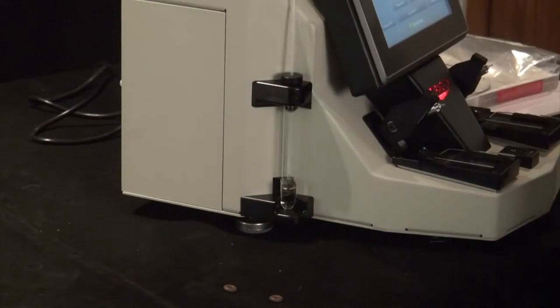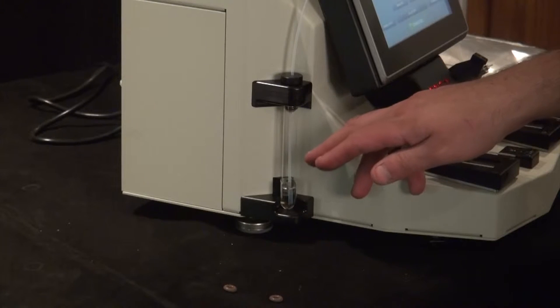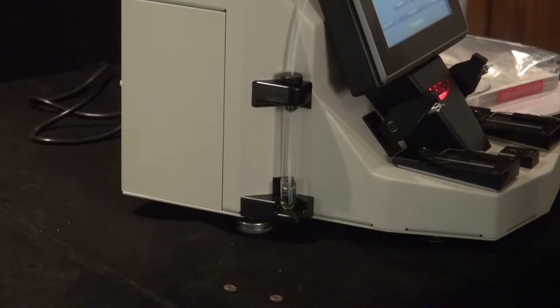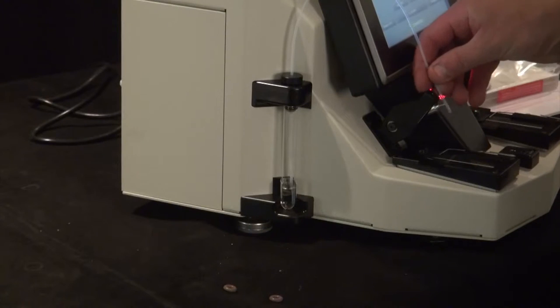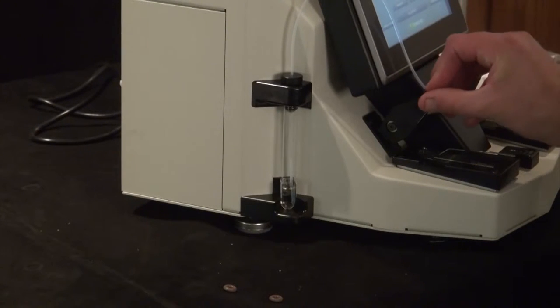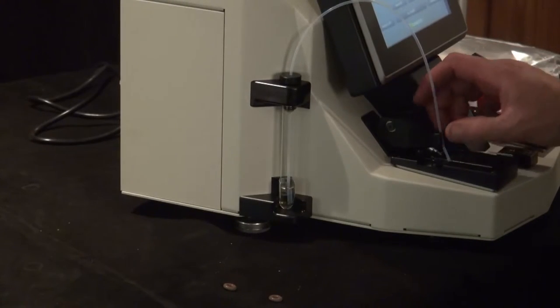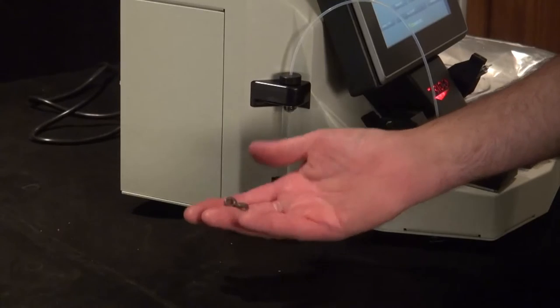After doing that repeatedly over and over again, you're going to find that your sample will sometimes go all the way up and reach just about the top, but it doesn't want to go over the crest of the top of the tube when it's bent over. That's a good indication that your seals are actually worn out. So what you want to do is go to your parts kit and you might as well replace all the seals right away.